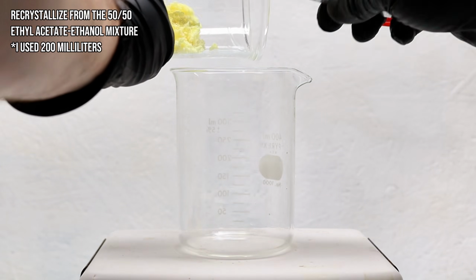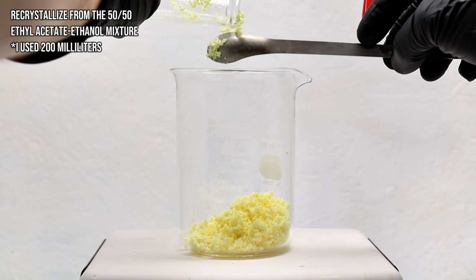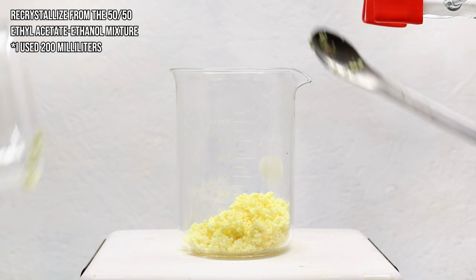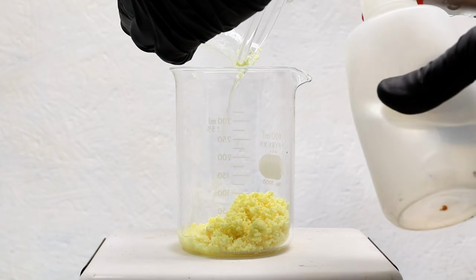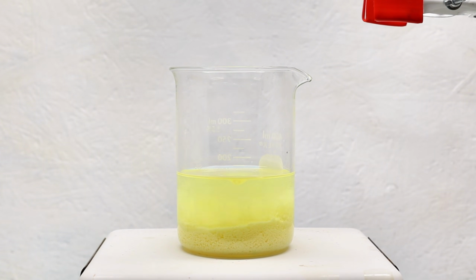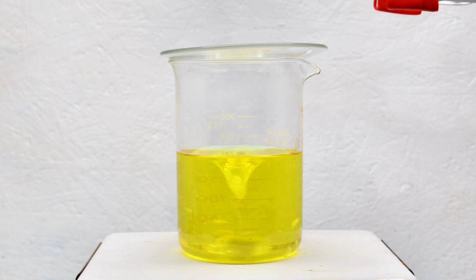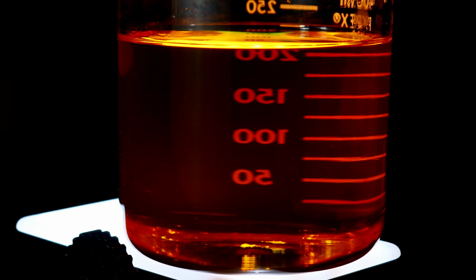The crude Benzil was then scraped directly into a beaker along with 200 milliliters of the 50-50 ethanol ethyl acetate mixture and heated with constant stirring until it had totally dissolved. Upon allowing this to cool to room temperature, thin, long yellow crystals of Benzil began to form, and even apart from the color, these looked very distinct compared to the benzoin crystals.